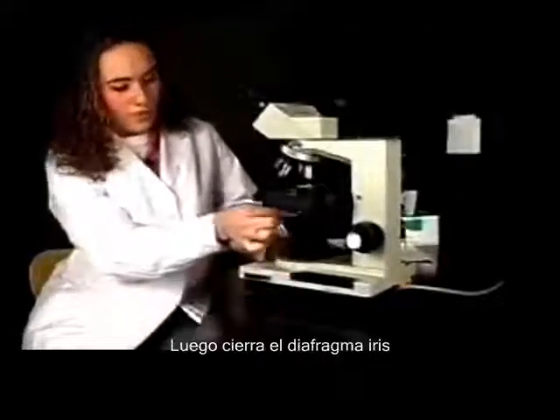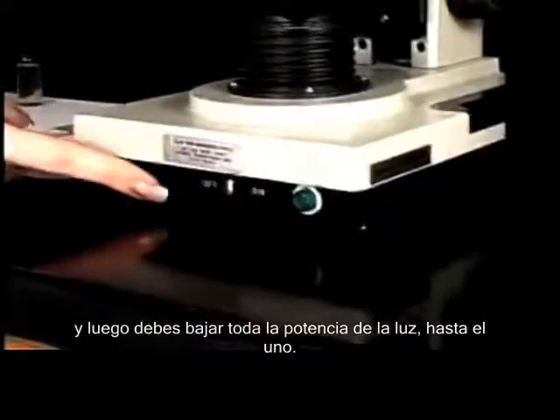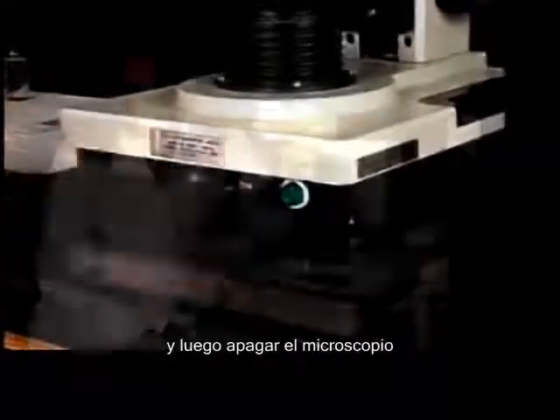You're going to close your iris. Then you want to turn your rheostat all the way back down to 1. And then turn off your microscope.